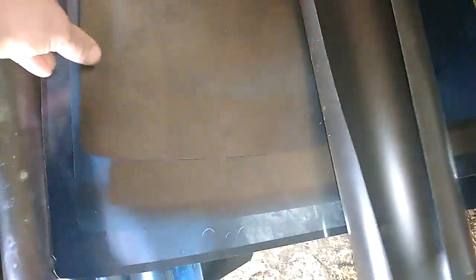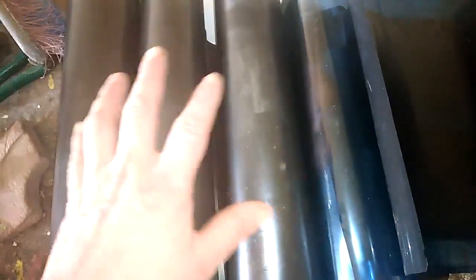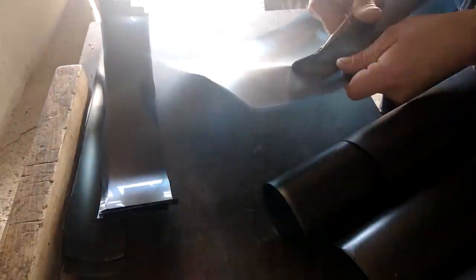So what I'm going to do first — I will take my scissors and I will cut these films into strips, because I want to recover all that silver in one beaker and not waste too much nitric acid. So let's make some strips from this x-ray film.